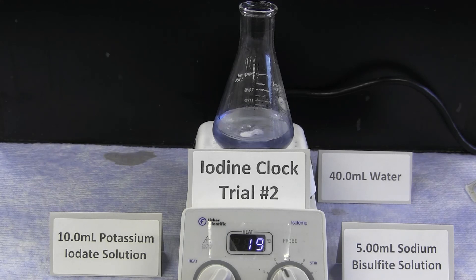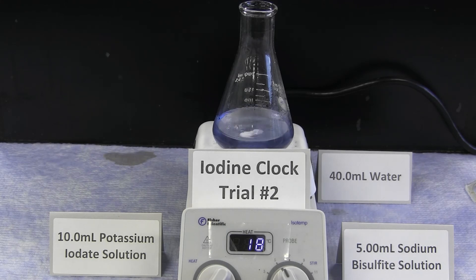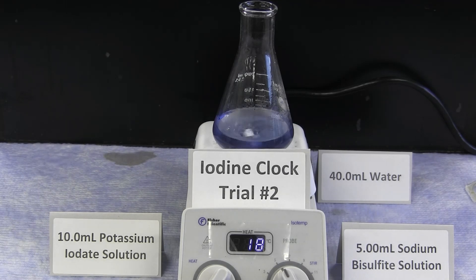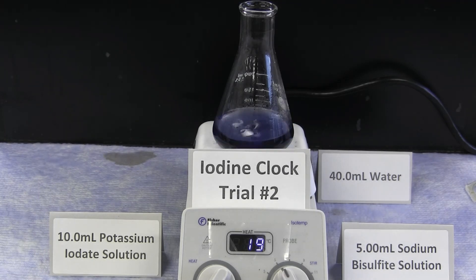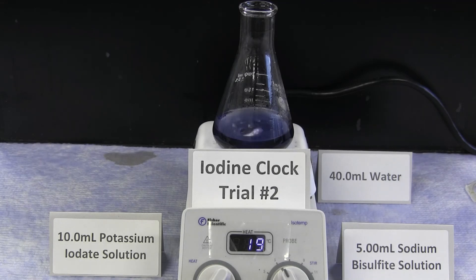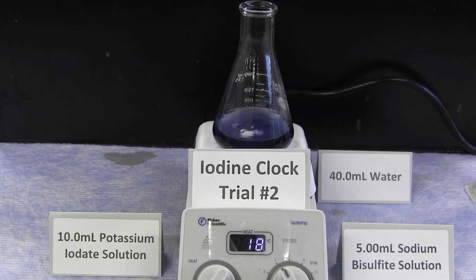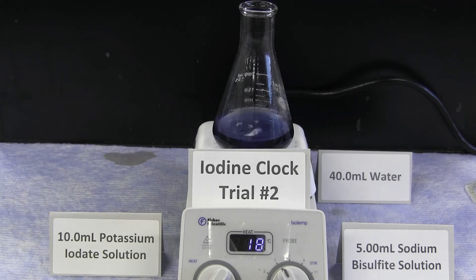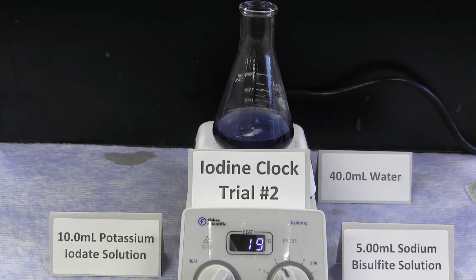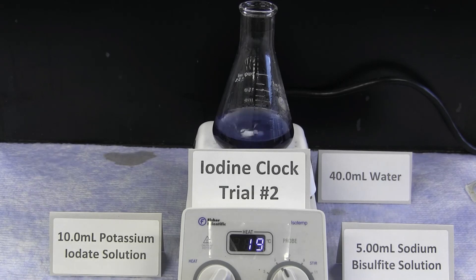The appearance of the blue color indicates the formation of iodine and the completion of the reaction. By performing this reaction in this way and determining the reaction order through a graphical method, you can determine reaction orders based on any variability of concentration, without needing to rely on exact whole factor numbers.